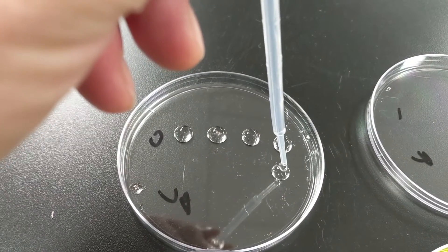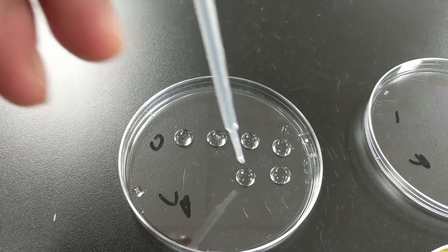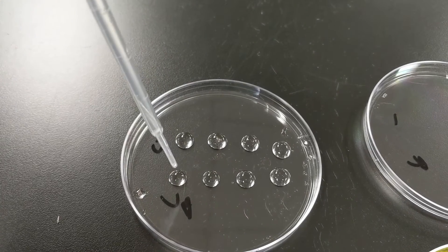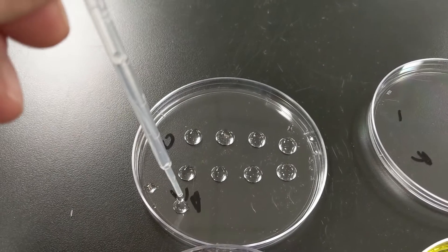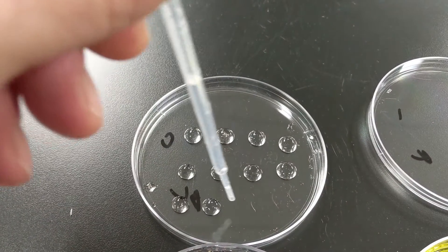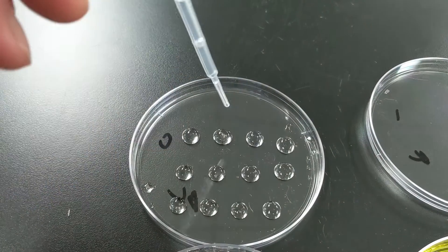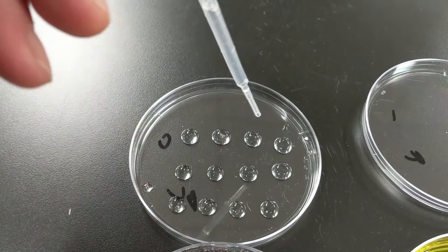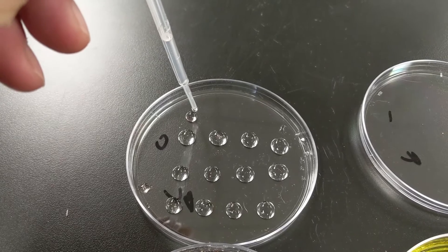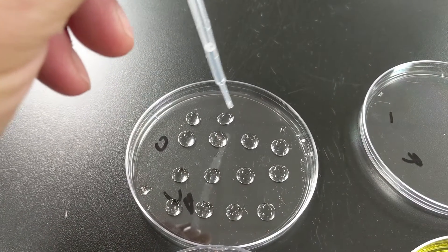So you can see there's a little mistake there, but we'll just plate these out. In biology, you always want to have 30 samples in professional biology. When it comes to statistics, though, I can work with just 10, and that's pretty good. Let's go with 16.